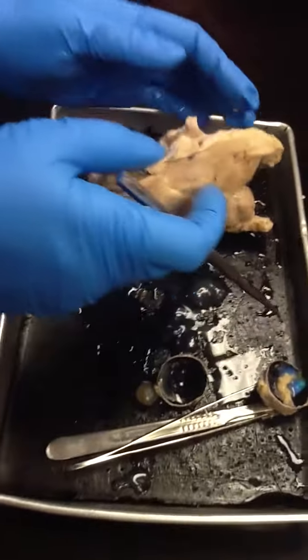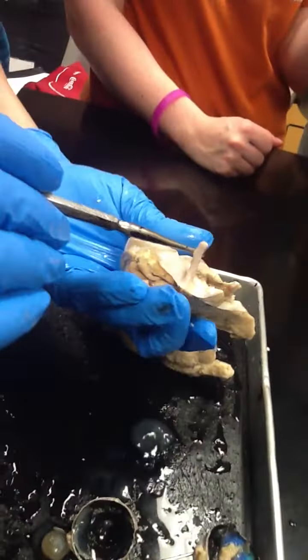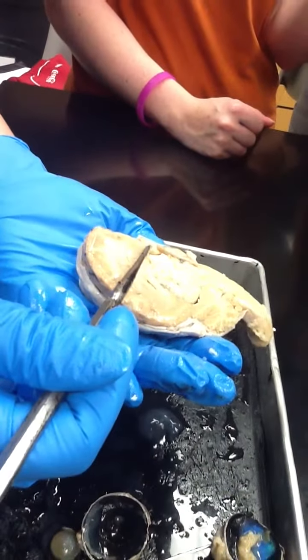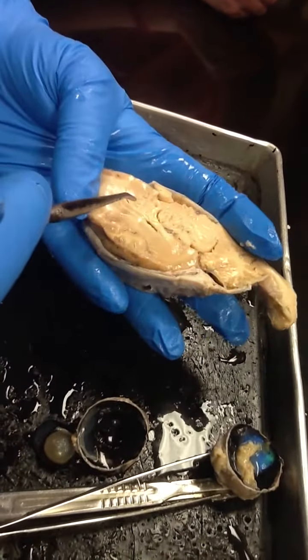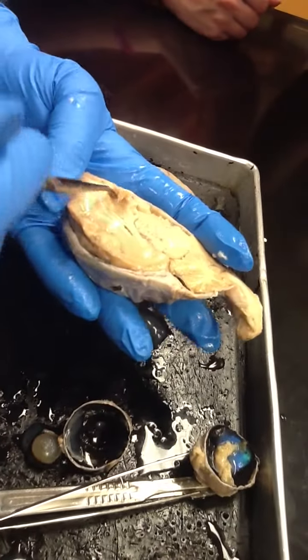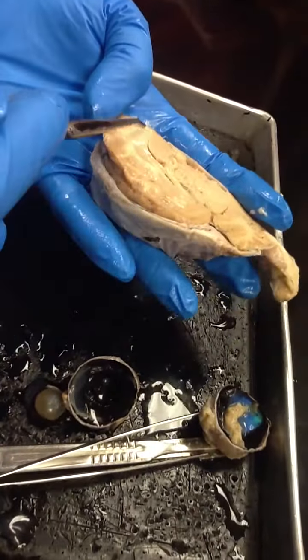Looking at the half brain, here's the dura mater. Right there is the optic nerve. Right here will be the optic chiasma. Right up here is the corpus callosum. Now, I'm not going to show you the ventricles on here because I have to open it up and actually show it. So I'm not even going to go over it.